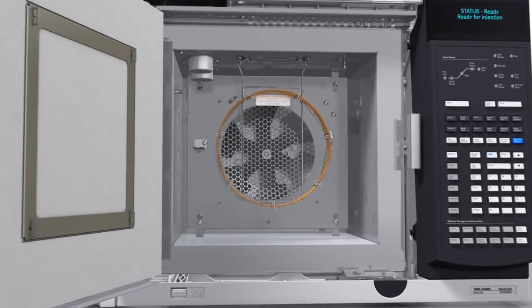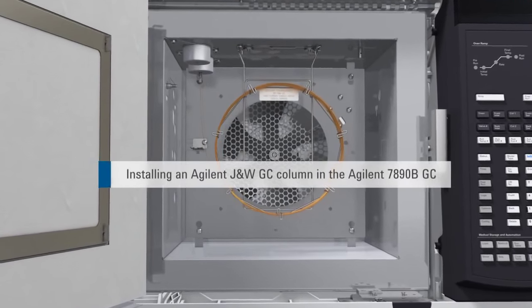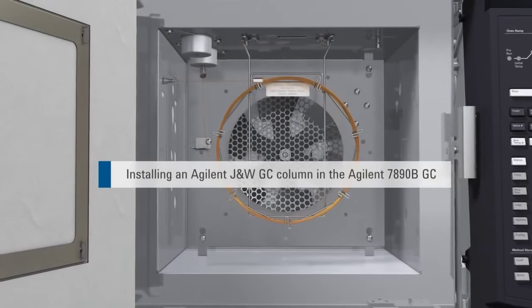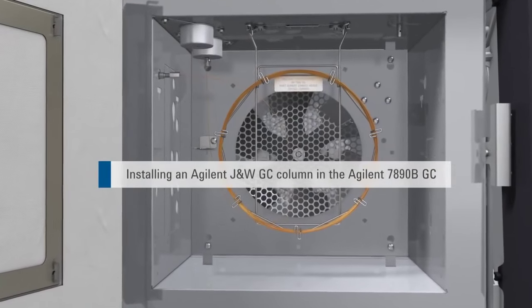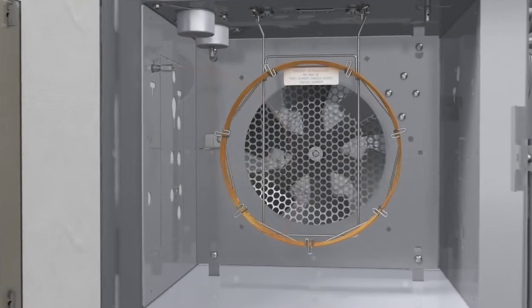The correct tools and supplies make proper GC column installation easier and ensure consistent, robust, leak-free connections and reliable results.